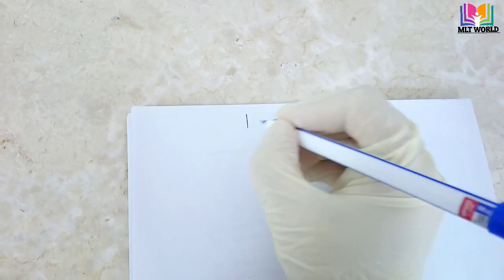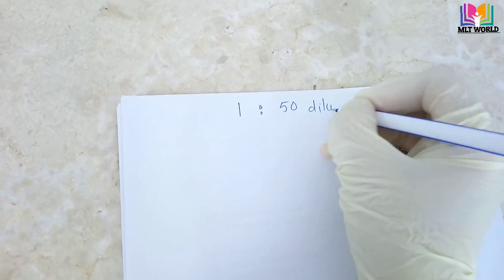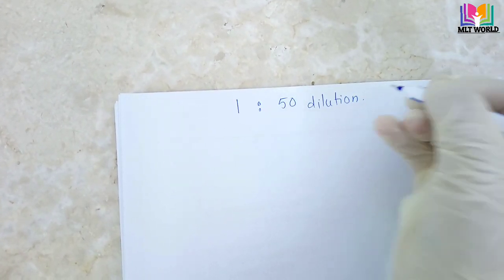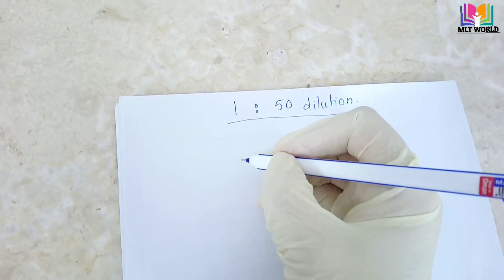Welcome back friends. Today in this video I will show you how to make a 1:50 dilution. In the last video I already showed how to make 1:20. We need a 1:50 dilution in two cases.